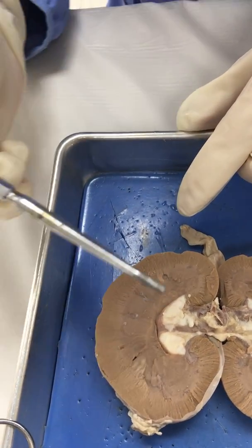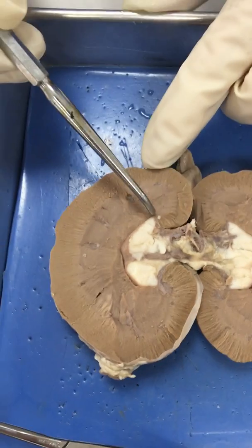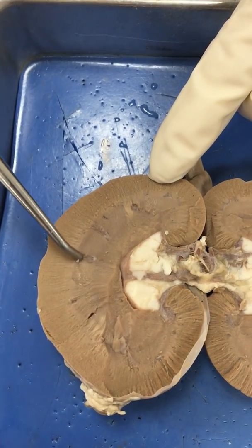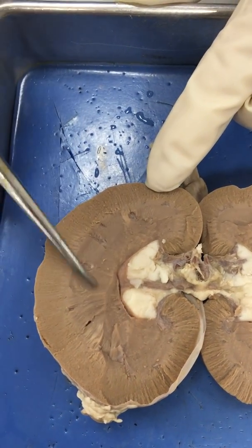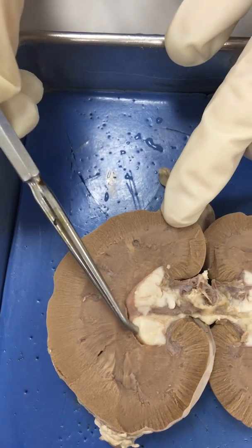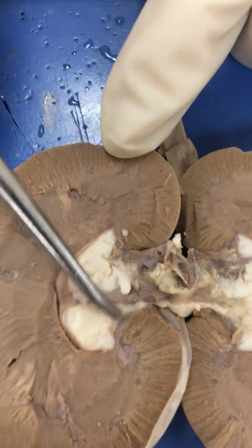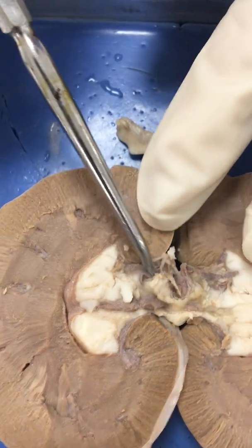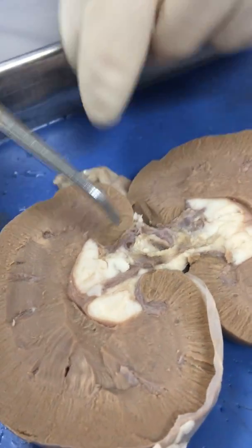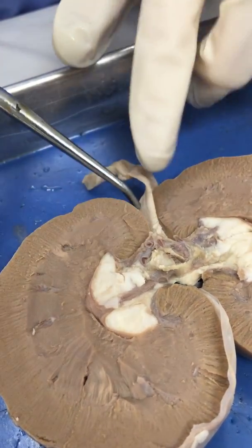That fanned-out area is our cortex — the renal cortex. There is a little bit of a difference in how it looks as you move inward. All of this through here is the renal medulla — the medulla area of the kidney. This area right here with a creamy color starts to run into our renal pelvis, and then leaving the renal pelvis is our artery, our vein, and our ureter that transports the urine out.